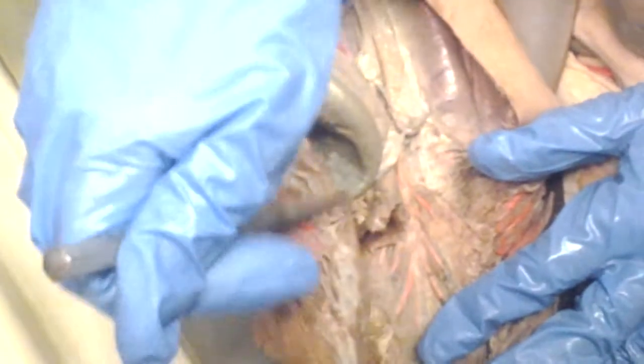Where's the ventral aorta? In the stomach. No, like on the top. No, this is all the dorsal aorta. And this is the heart. The ventral is on this side. If we were to dissect this out, you would see the ventral, next to the afferent. The afferent is on this side. Efferent is on this side. Efferent is dorsal, yeah.